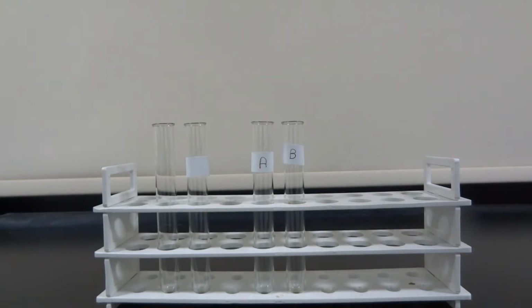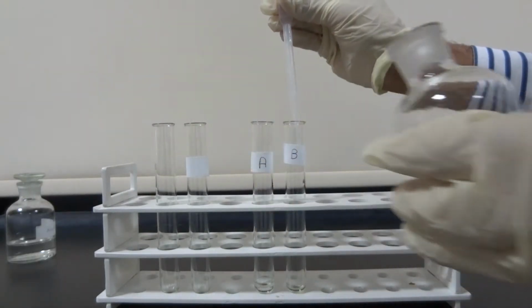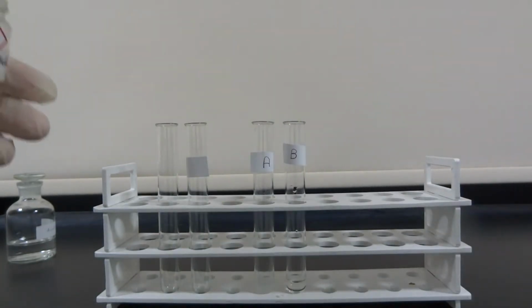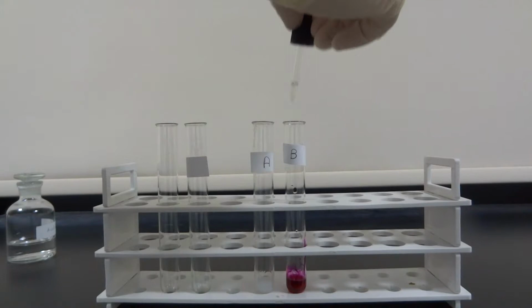In this experiment, the scientist would like to detect which solution is acidic, solution A or B. Already the scientist knows an indicator color that changed non-acidic solutions into pink. So he took a few milliliters of each solution in a test tube and added a few drops of the indicator color by using a medicine dropper.